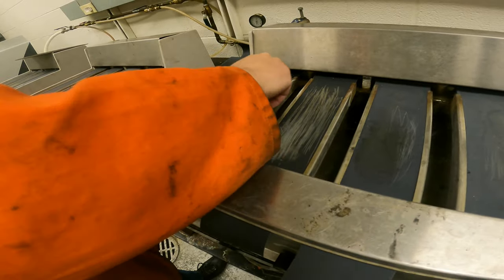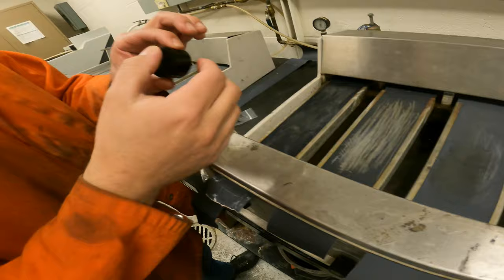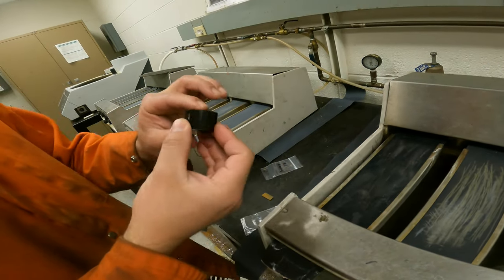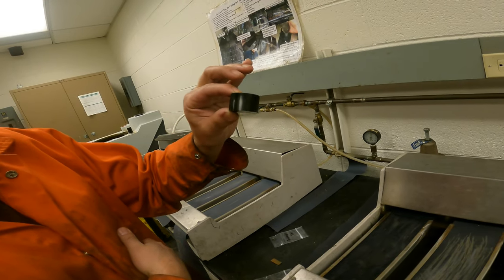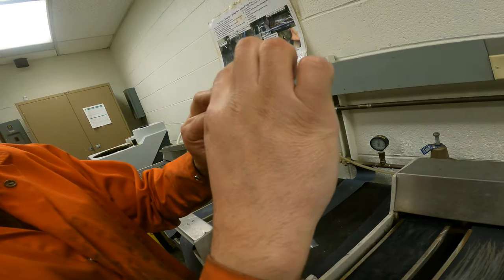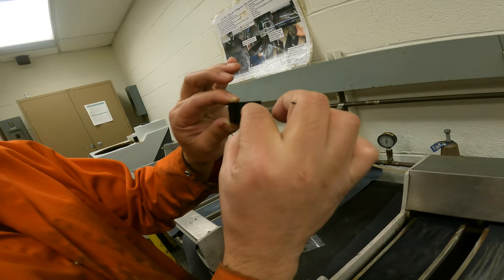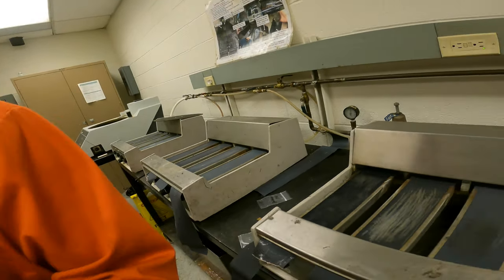So I just go around and remove this sharp edge to avoid cutting your fingers. You see the height is around three quarters to one inch, which is the desired height. If you put too much bakelite, it's going to be too tall and difficult. If you put too little, it's going to be too short, also a problem. Depending on the size, you can change your amount.